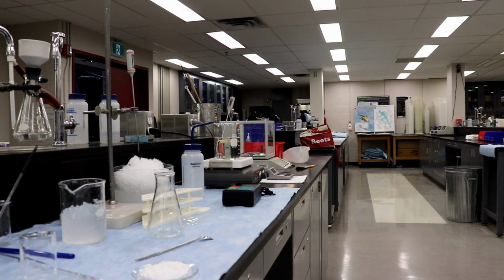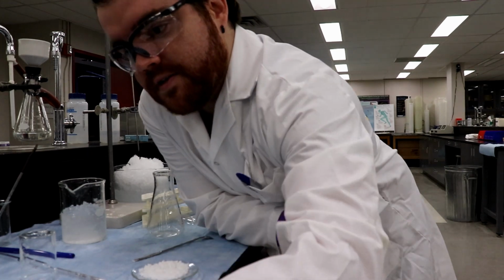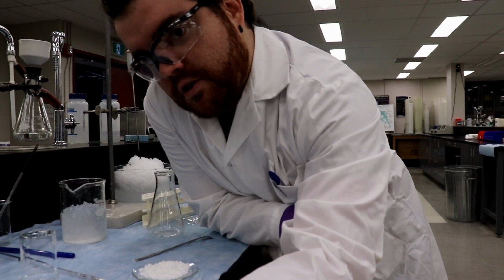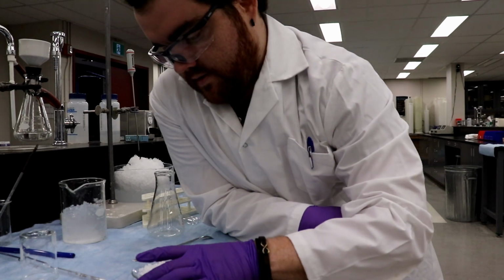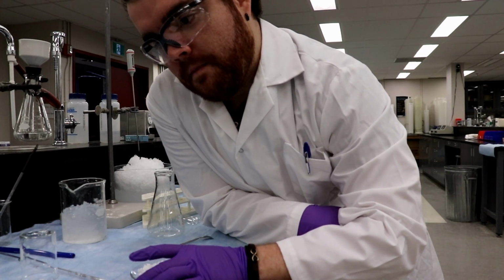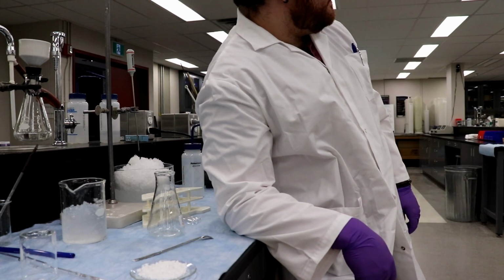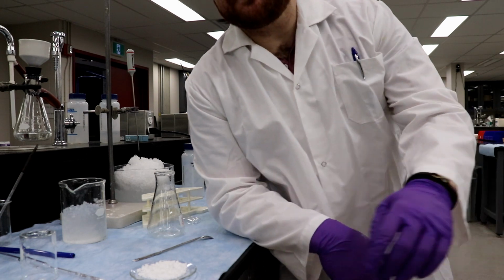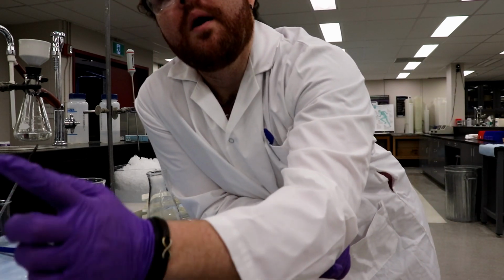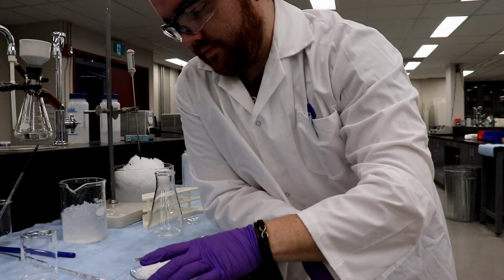Okay. So while Ingrid's doing that, we're going to pop back over here for 2 seconds. I can see myself now because the viewfinder's out in front. Okay, transfer the crystals to a watch glass and place them in a drying oven for 20 minutes. And then... Oh, actually, Ingrid, we don't do the weight until after. No, but I'm going to look at the formula weight and figure out... but what I'm saying is according to the procedure, we weigh only after the oven. Oh, after it's dried. But this is a nice thing to do beforehand as well, so you can see how much is moisture. Water. Okay, this is good.